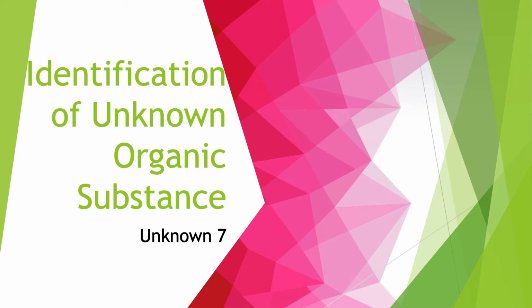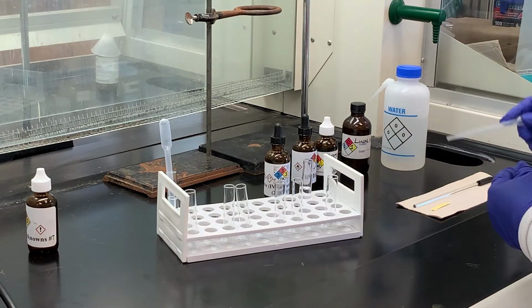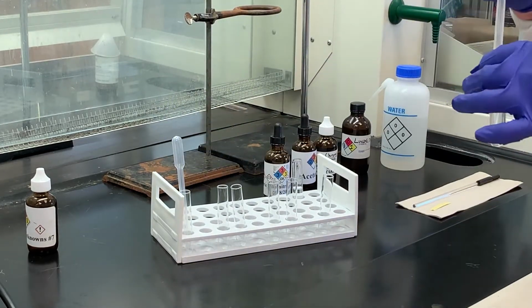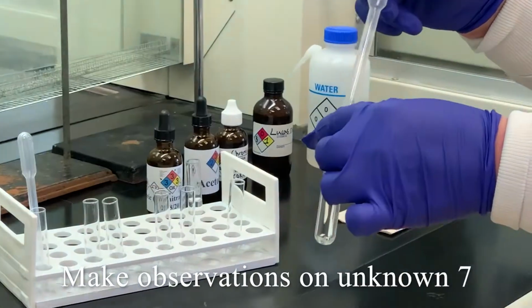The first thing we're going to do, we have unknown number 7, and you'll be given physical data in terms of how to calculate your density, so on and so forth. So the first thing I want to do is to just kind of show you what the liquid is. I poured some of the liquid into a separate container, a test tube.